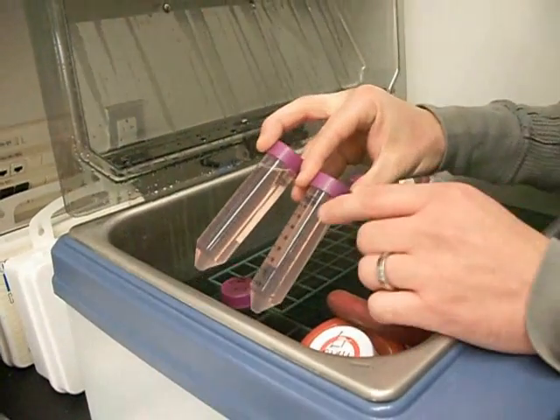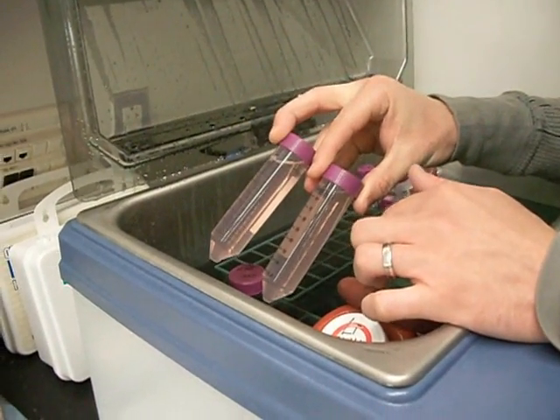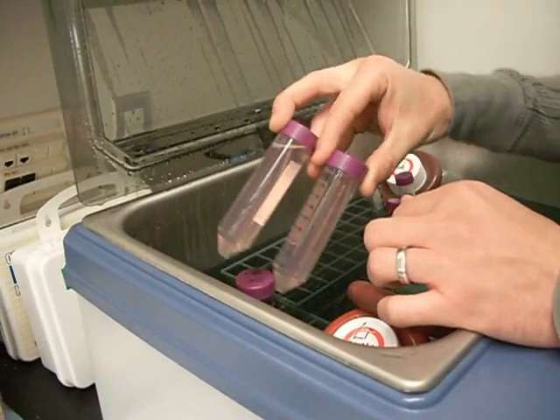You also need to have your media that you're going to use in your experiment to be pre-warmed in 37 degree water bath.